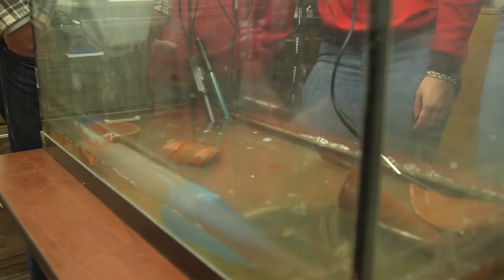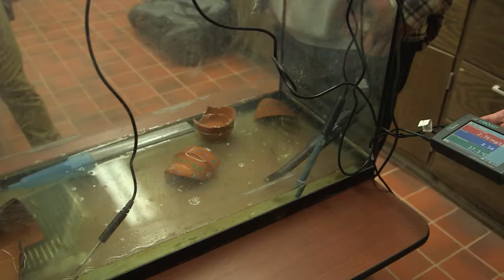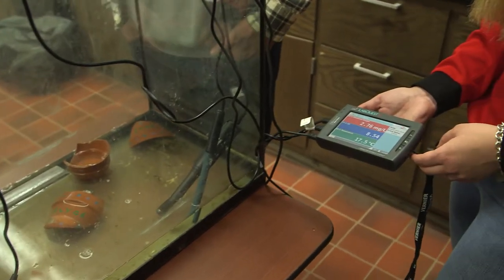What was that called? Biological oxygen demand — BOD. Is that what happens in lakes or rivers when you see fish belly up? That can be one reason. We're getting a reading of 2.91. Higher demand, less oxygen.